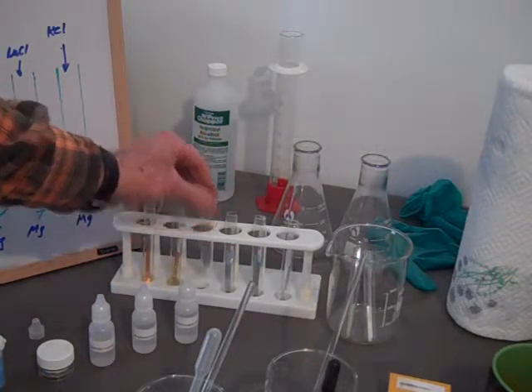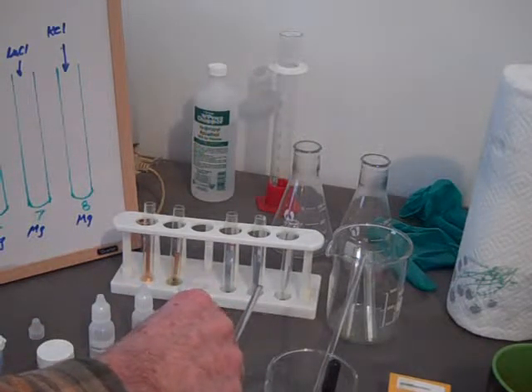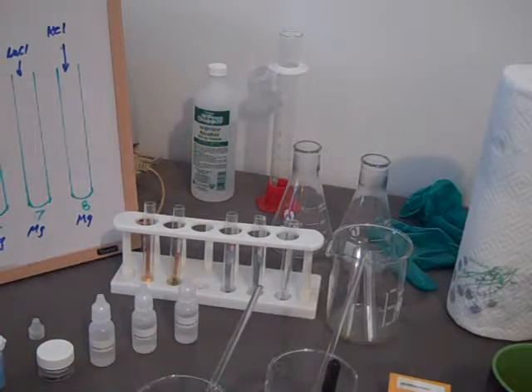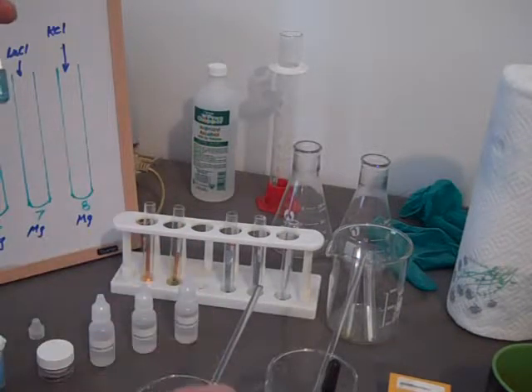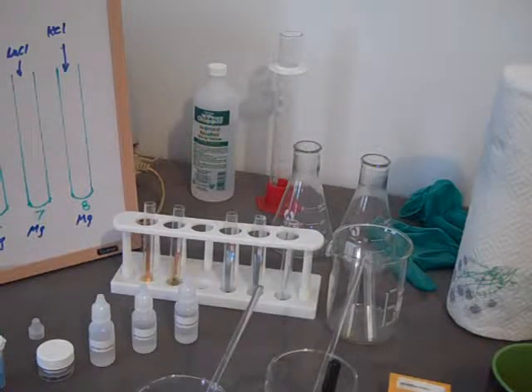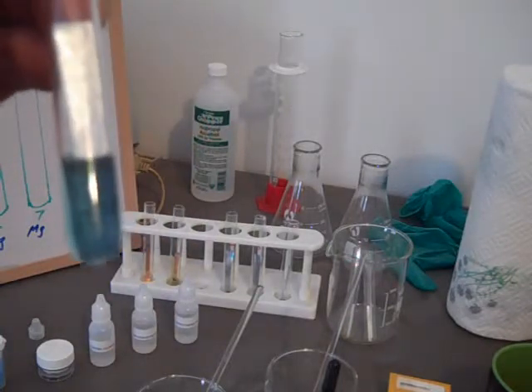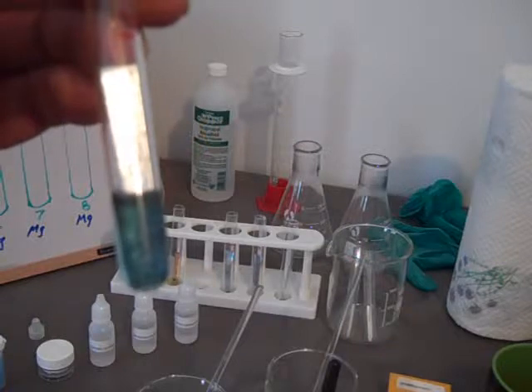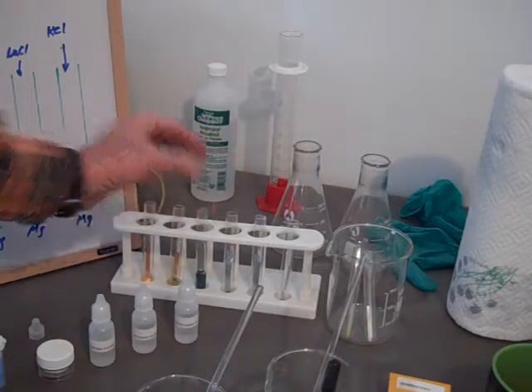That bears out what we thought it would do. The next one is copper sulfate, and I've prepared some 0.2 molar copper sulfate. Let's see if we can predict. Zinc is higher than copper on the activity series. So zinc should replace the copper here. Right? Let's see what happens if we're right. Put some copper sulfate in there, and observe. Indeed, again, we see some graying on there. Can you see that? I can't get the strips out, unfortunately. But it's much darker than the bright zinc above it. So we did get a reaction there. That bears out what we predicted.